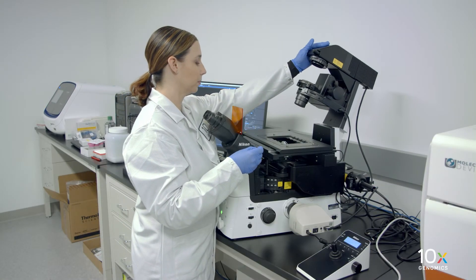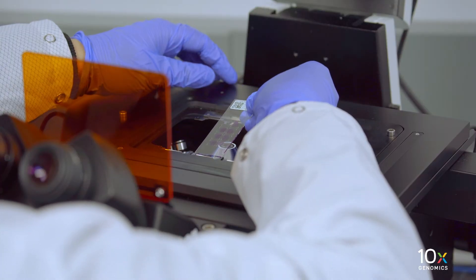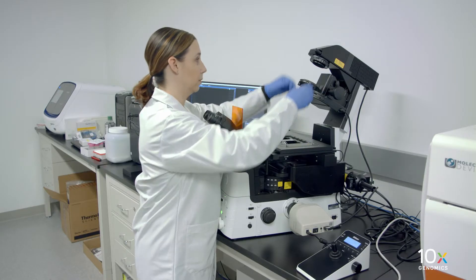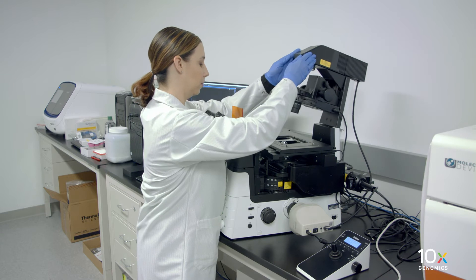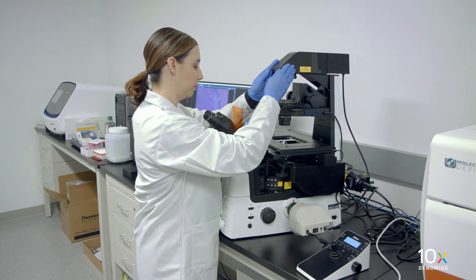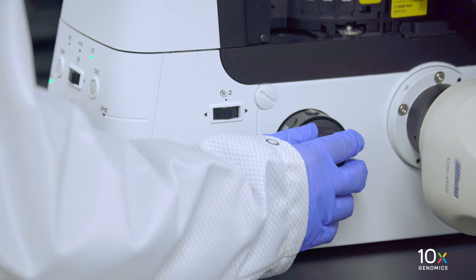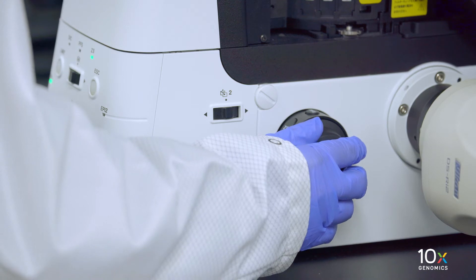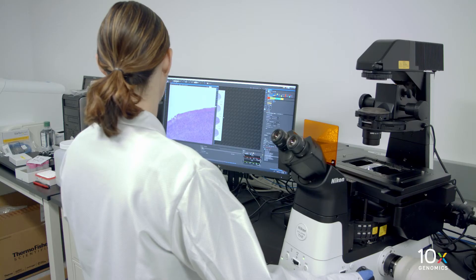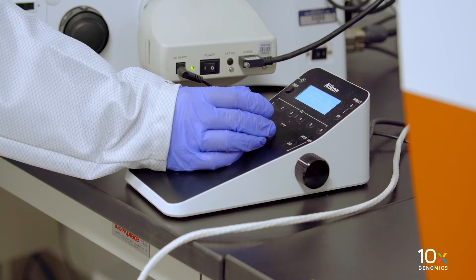Place the slide on the microscope stage. Ensure that the image is in focus and the scanning area is defined.